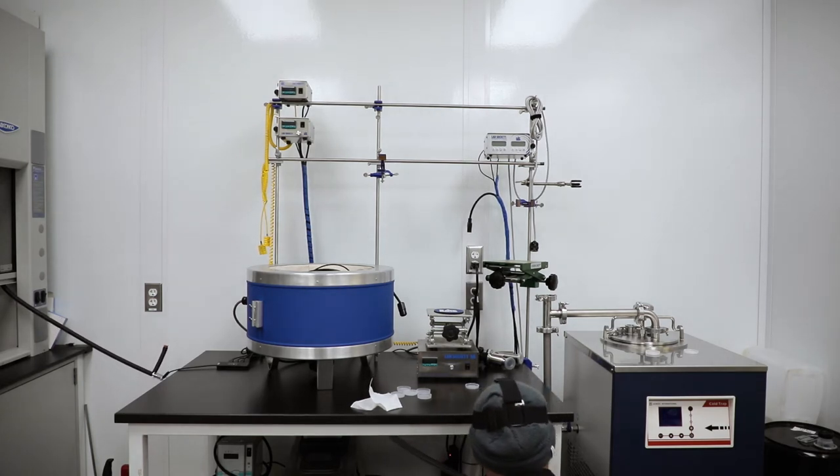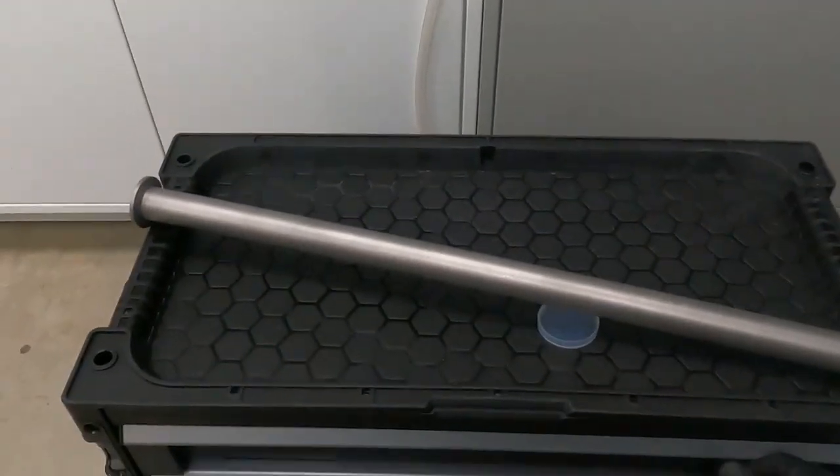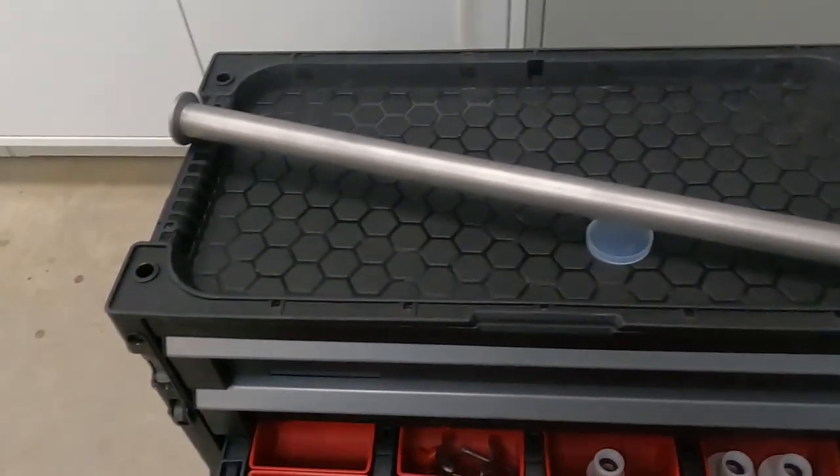Finger tight, no reason to do anything crazy. I'm going to close this valve. Last thing to do here is connect our inlet to our cold trap and then we're ready to assemble the actual glassware of the system.